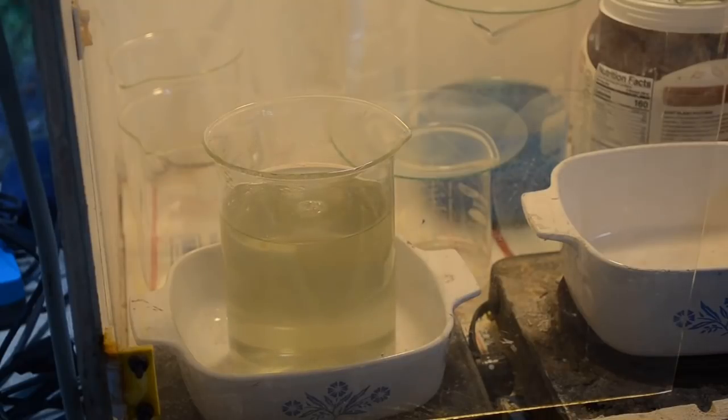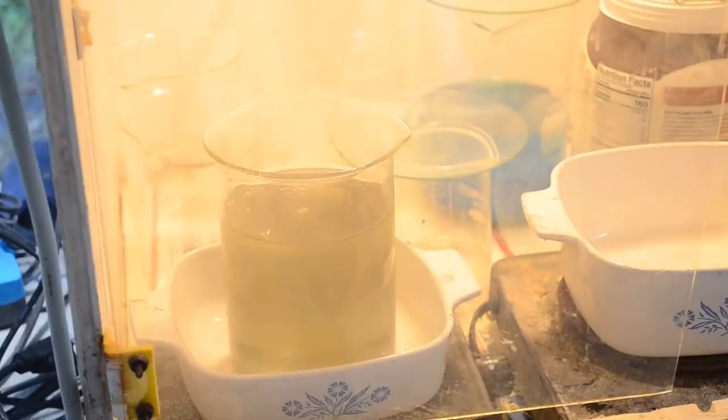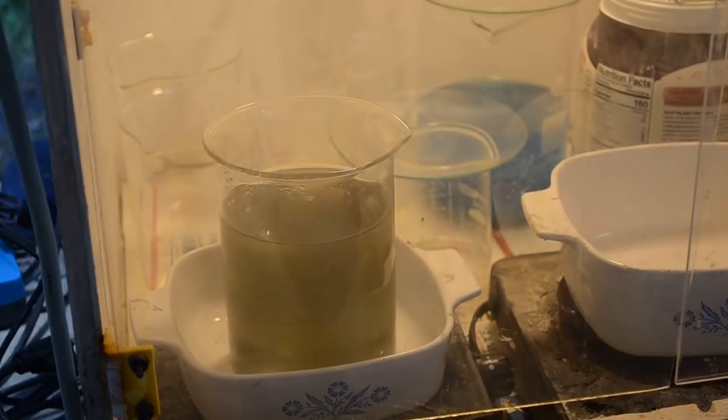Nice. Yeah, it's starting to darken. It's starting to darken. Yep. Here comes the gold. Lovely. Oh, let me get the fume hood going before I get a lungful of that sulfur dioxide, although it's not really bubbling out of solution. Yeah, look at it go. Wow. Okay.